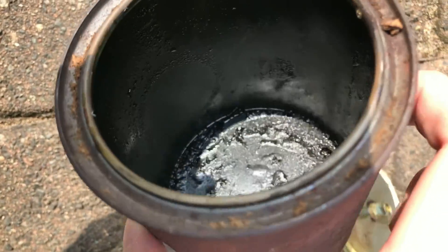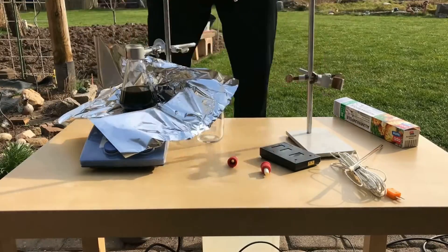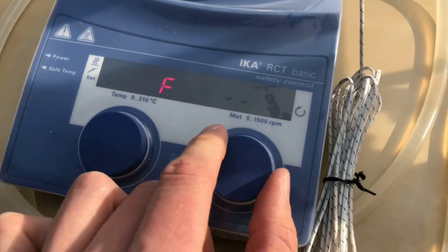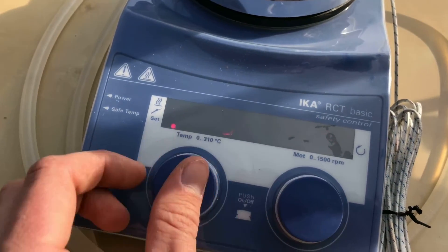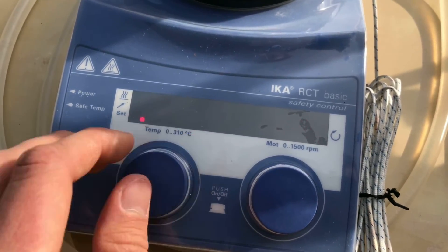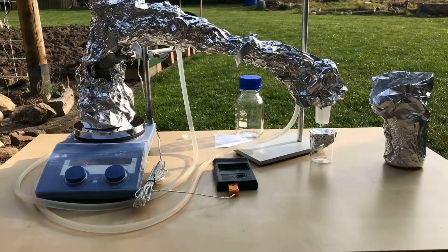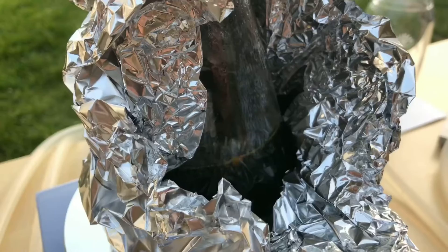The next day, I was ready to purify the styrene. Fortunately, it was still liquid and hadn't solidified yet. A simple distillation apparatus with a new hotplate was set up. We still had to figure things out, but after a few seconds of trying, we were able to activate the hotplate and also the stirring. The display might look strange and broken on camera, but to the human eye it looks just okay — it doesn't flicker. The flickering effect you see is due to the frame rate of the camera. A simple distillation apparatus wrapped in aluminium foil to prevent polymerization of any styrene was set up to fractionate the styrene.